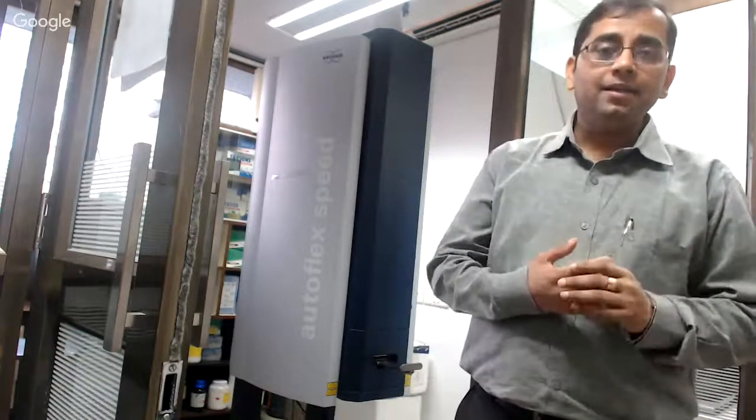This live session is essentially to teach you about one type of mass spec, which is MALDI-TOF. In the basic lectures, you are getting an idea of how proteomic technologies are evolving, and in which ways we can use different types of mass spectrometry instruments for proteomic analysis. Of course, it may still be early after just week one for you to be on top of these technologies. But we keep showing you lab views and some of the actual instruments, and what one could do with them. So today we thought to show you a demonstration of MALDI-TOF instruments.